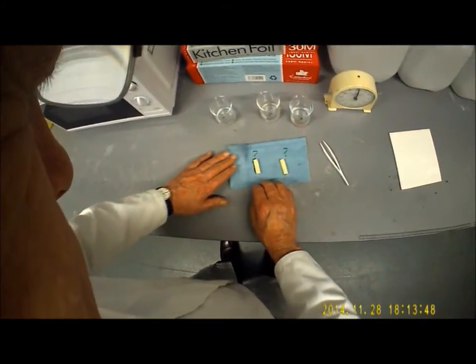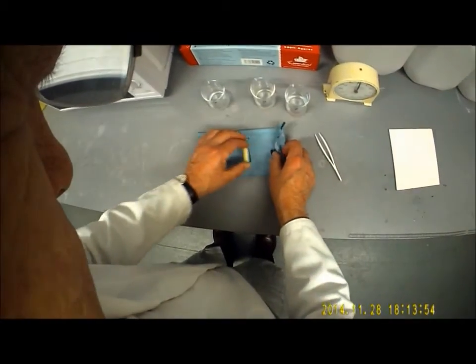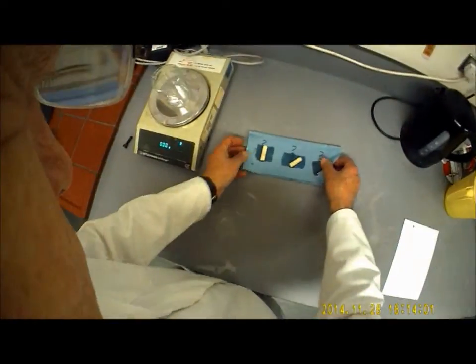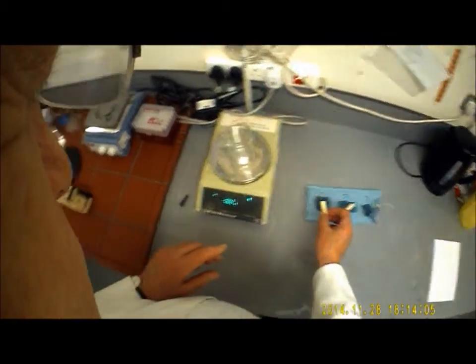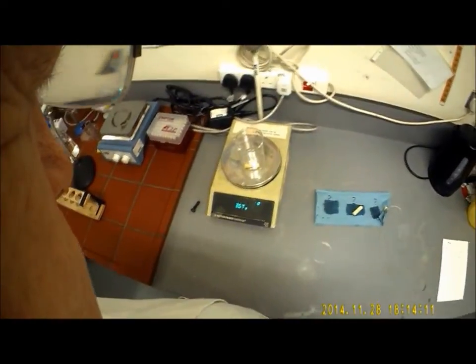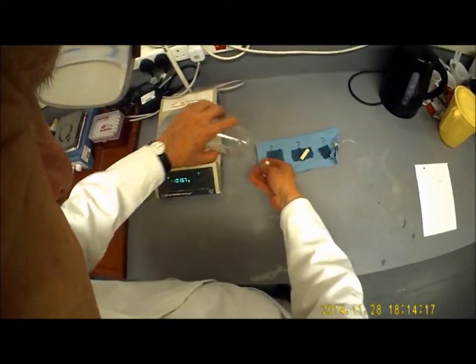I'm going to roll them to get rid of the surplus moisture, like so, and like so. And then I'm going to take them over to the scales and reweigh them. Remember, only I know what these solutions are. So there we go. This one's 3.67 grams. That will go into my 5-minute box for whatever concentration it was.